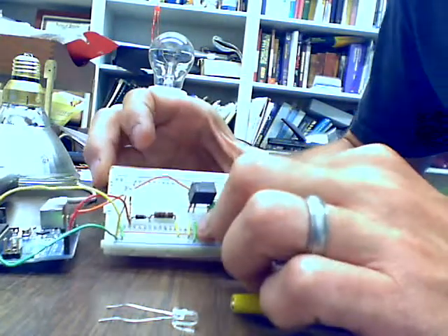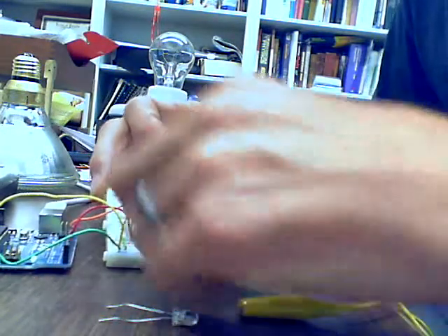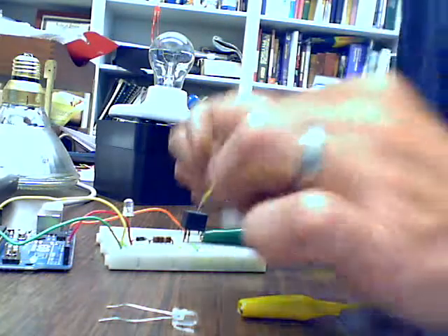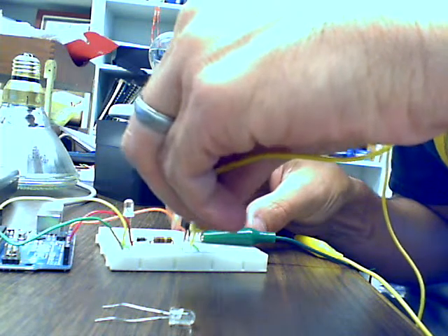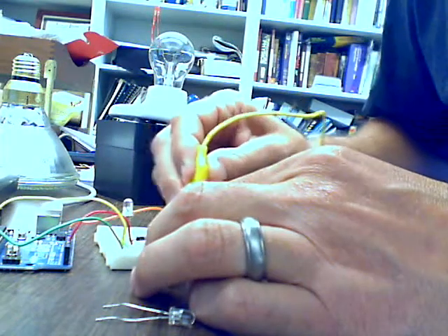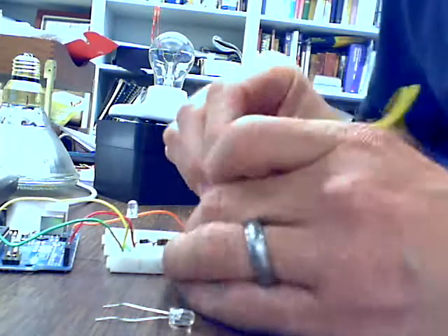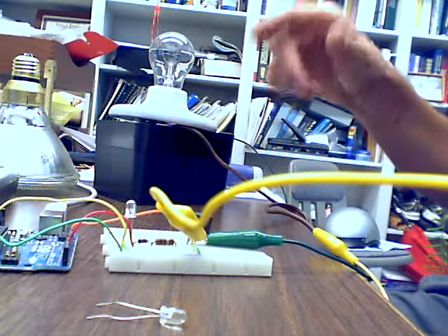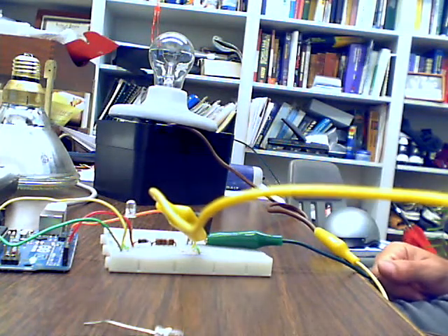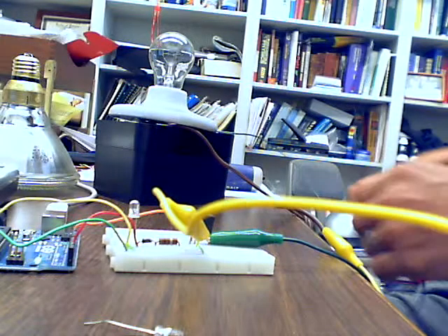Okay, and then this yellow is going to replace the yellow one that was connected to row 15 of the relay here. So I'm going to take that wire out, but then I'm going to plug it back into row 15 here so that I can connect my alligator clip to row 15. There's no way for me to connect alligator clips to the breadboard without a wire sticking out like this. And again, I'm trying to make sure that everything is covered. I don't want anything exposed that has the 120 volts coming out of the wall. And for a 40-watt light bulb, that's going to be a quarter of an amp or something. You don't want to expose yourself to that.